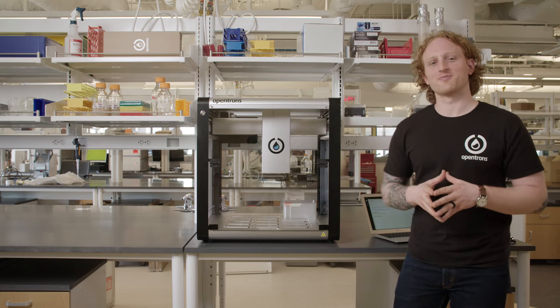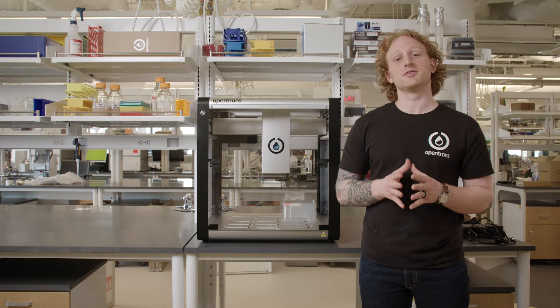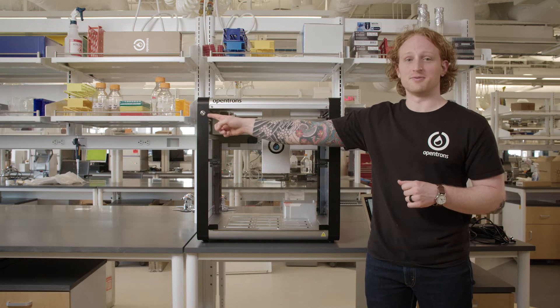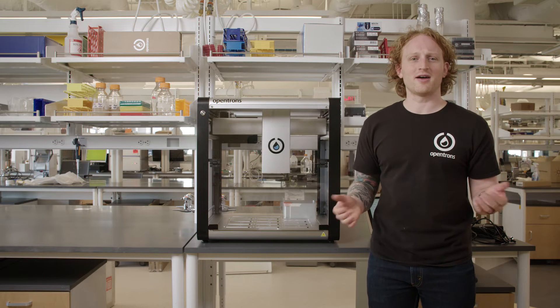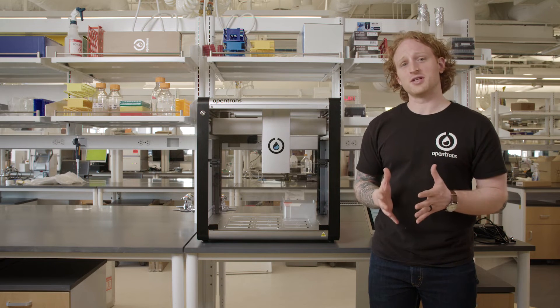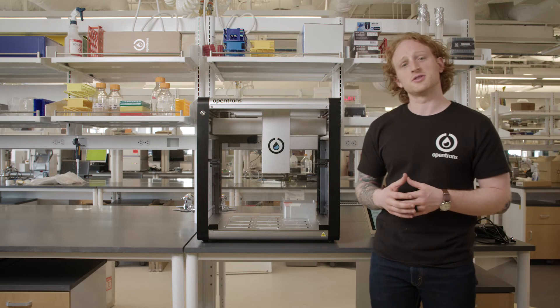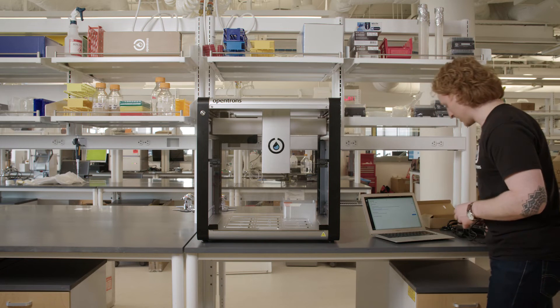Now let's connect to the OT2. First, I need to make sure the OT2 is plugged in and it has a solid blue light on the front of the machine. I get asked this a lot, but the button on the front of the machine does not do anything. At the moment, the support team uses it to make sure the OT2 is properly booting. Let's get started plugging it in.